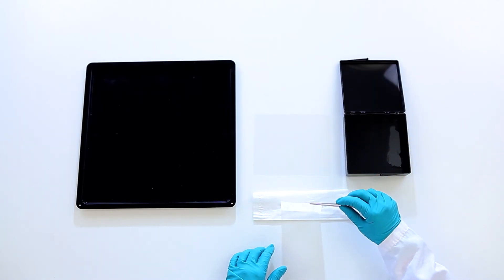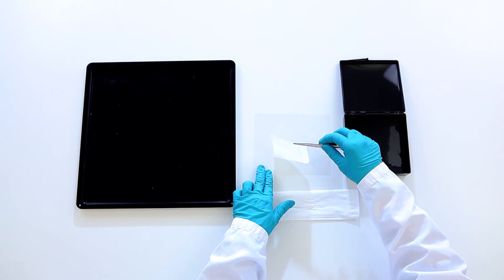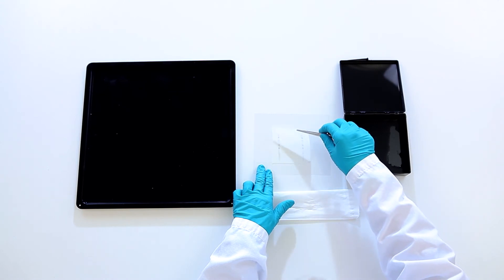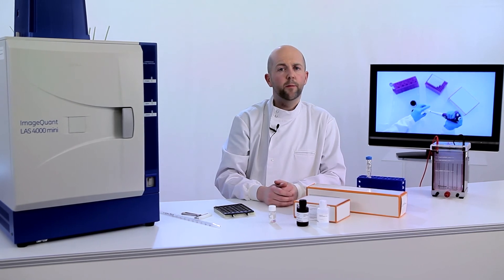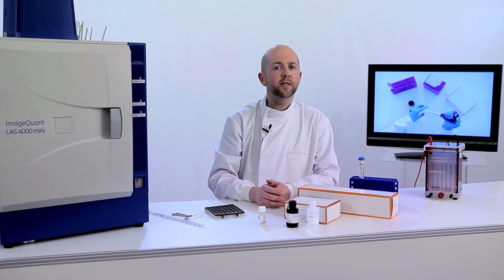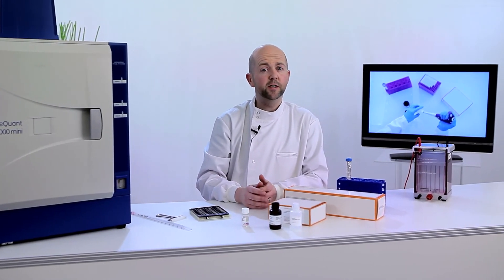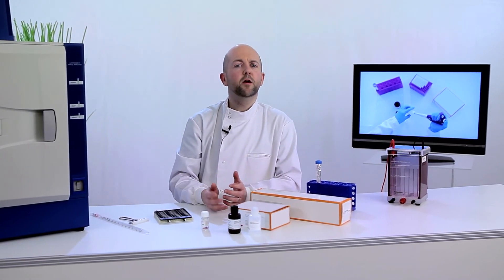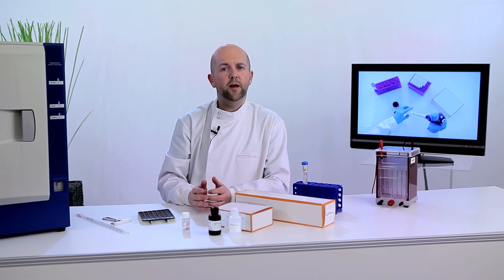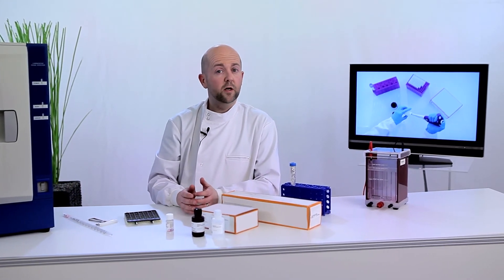Drain and place on a clean, smooth surface such as plastic film. Now you are ready for detection. X-ray film can be used, but a CCD imager with high sensitivity and broad dynamic range is a better choice for detection. There is no time pressure. The reaction is instant and the signal will last for hours.